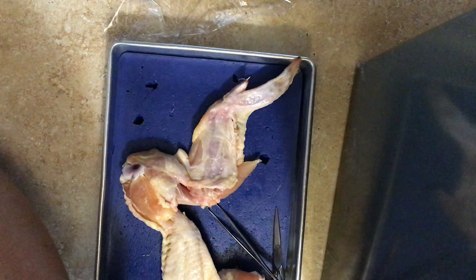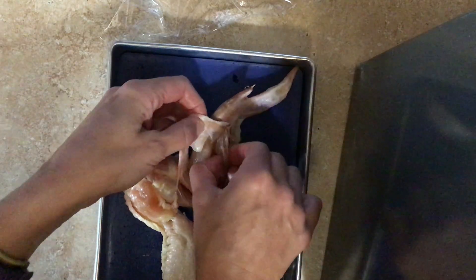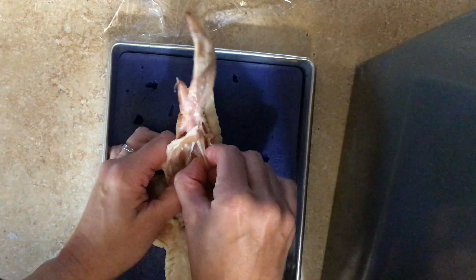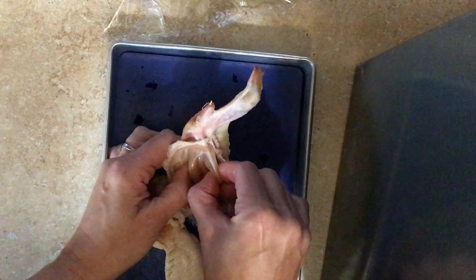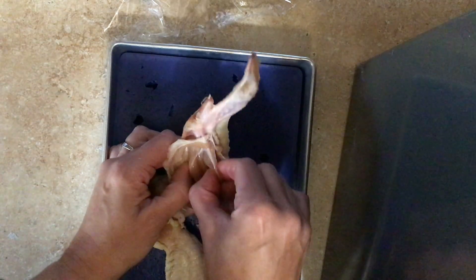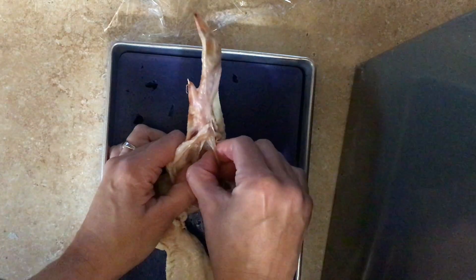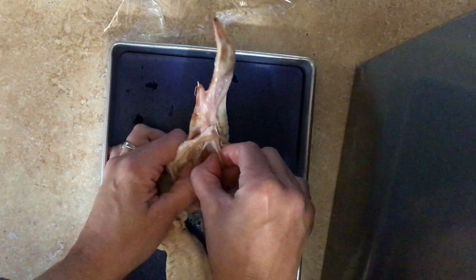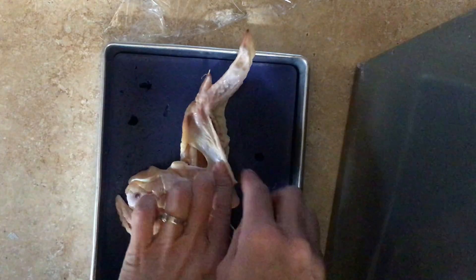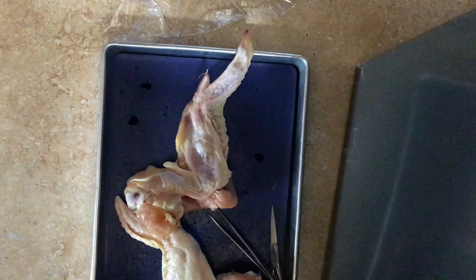You should be able to fill everything else out. The big thing to know — which I pulled on this muscle to show — is that the only way chicken wings work is pulling on this muscle moves that chicken wing, but we have to think about what it's actually moving. It's actually moving that bone. What connects muscles to bone? If we contract our muscles, our bones move, but the only way they move is because muscles are connected to bone by something — and that's connective tissue. Keep that in mind when you answer your questions on the lab.